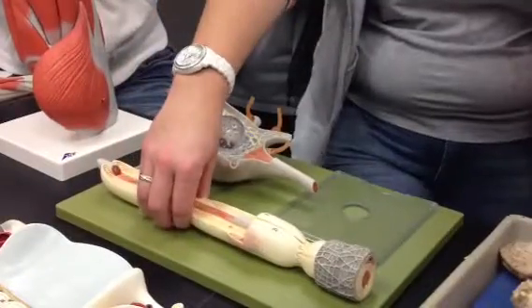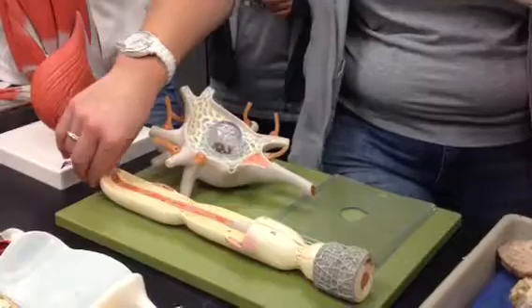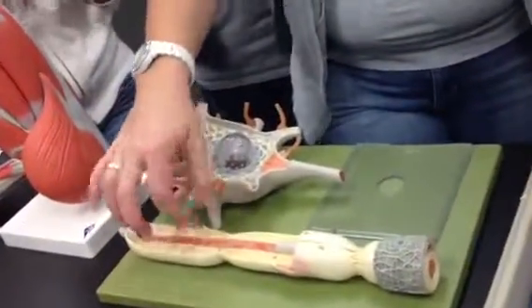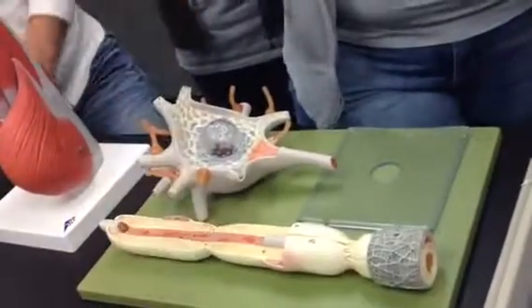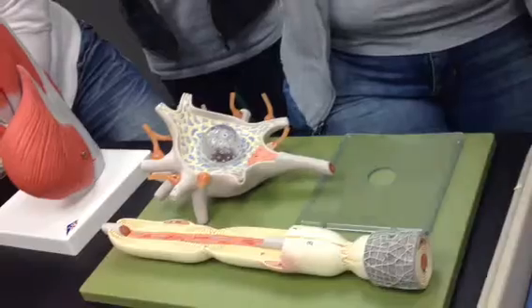Well, they're myelin sheath, right? But what kind of specific cell is it? Schwann. They're Schwann. And you can tell because the oligodendrocytes look very different. They don't have one nucleus per cell like this. They have one nucleus per cell, but the cell encases lots of different neurons.